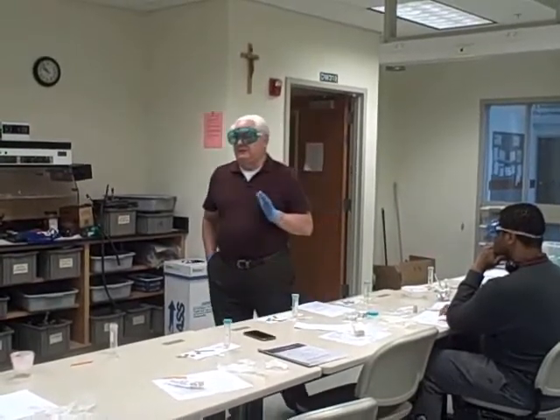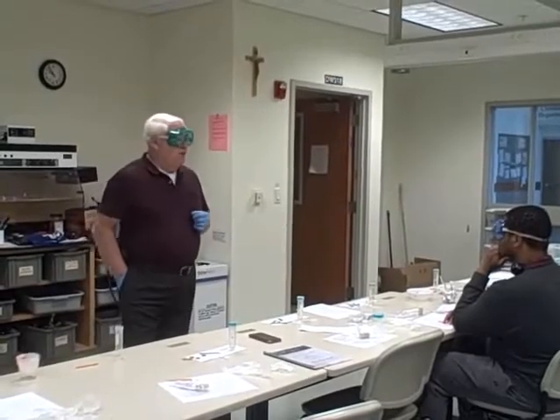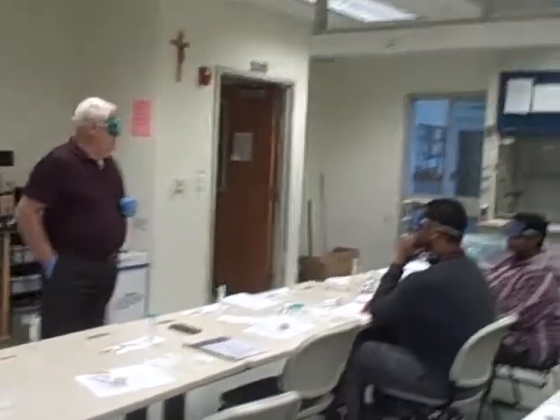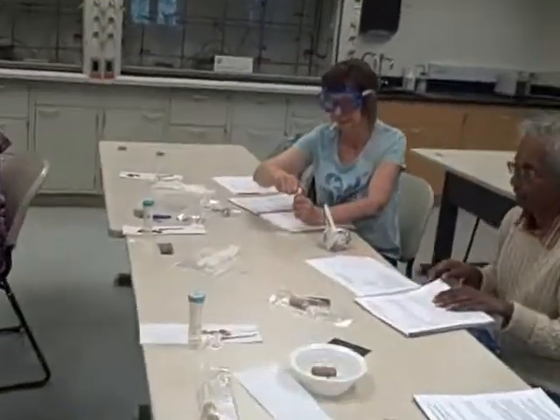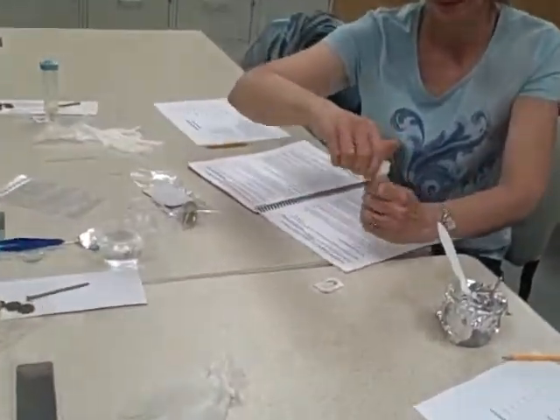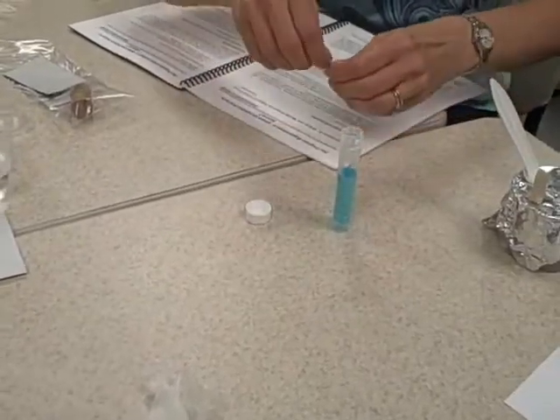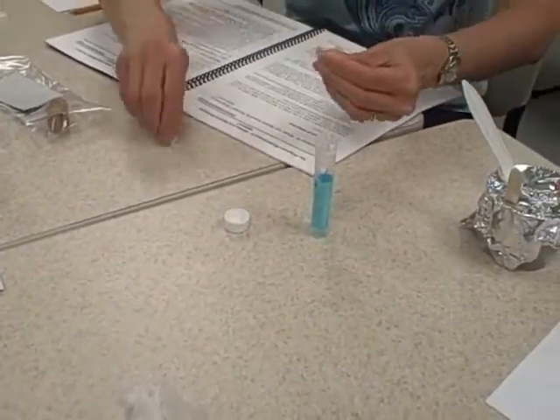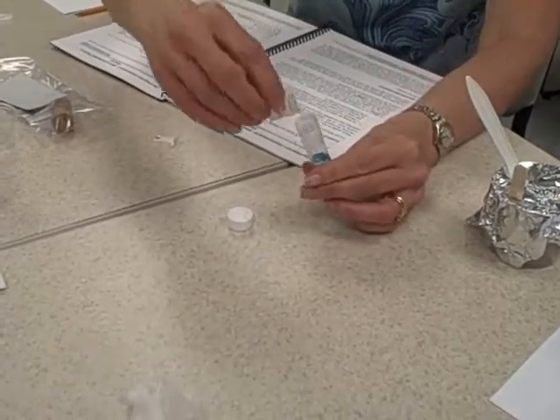For some reason, that step was neglected. So we put a packet of salt in with this experiment in all the kits. So if one of the students would pick up the packet of salt, open it up, and open up the 10 mil vial, and put just a pinch of salt into that 10 mil vial.